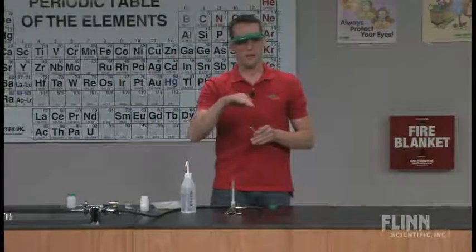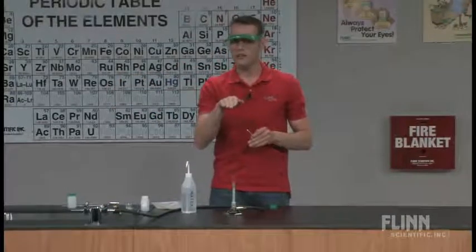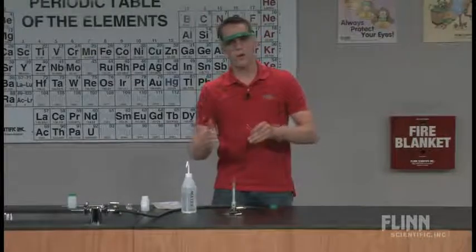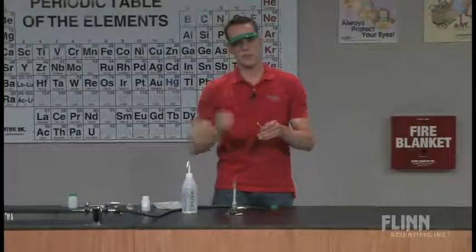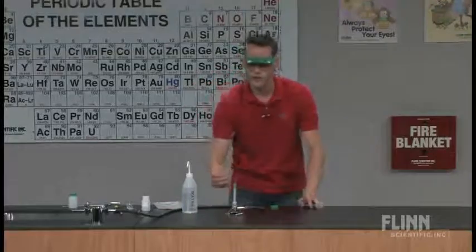They are at this point familiar that the hottest part of the flame is that tip of the cone. We don't want that. We actually want the outside of the flame. You get a better flame test that way. So if we can turn the lights off.